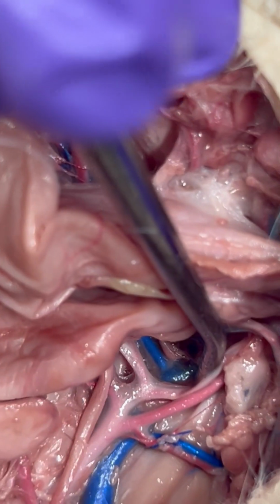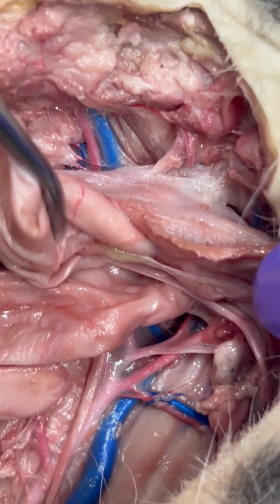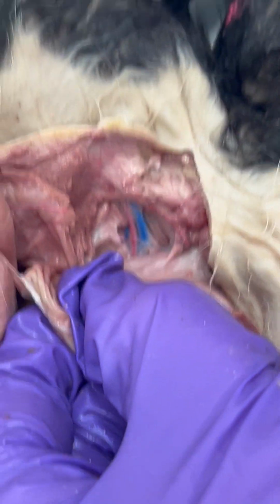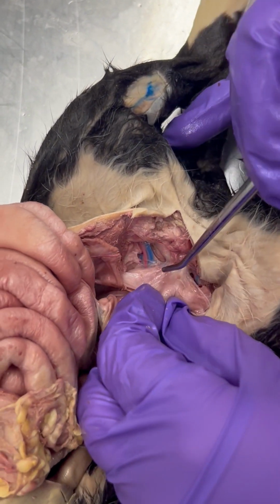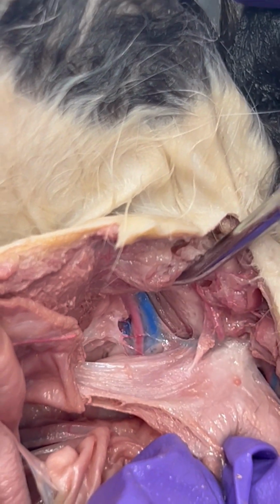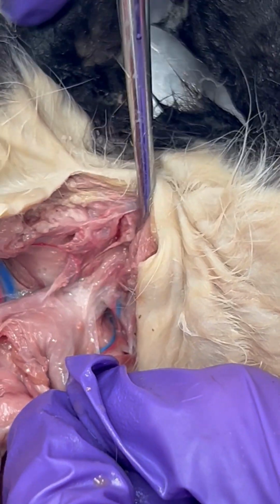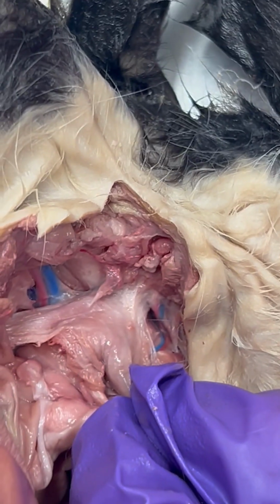I'm just gonna give the camera a second to focus. And then I'm just gonna show you from a slightly different angle here. Since it's going into the legs, you can see where that branching happened. So here's the cat's left leg, and we can see a branch. And the right leg, the dye is not as thick, but we have that coming down the right side.